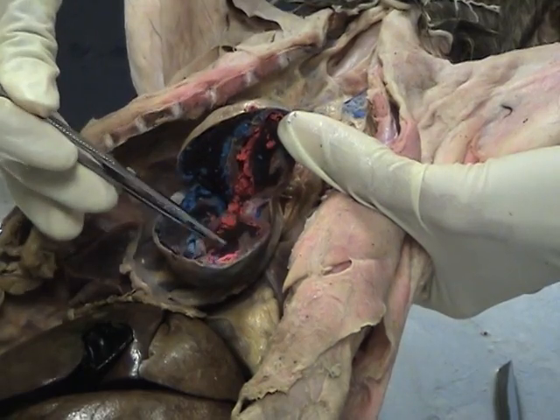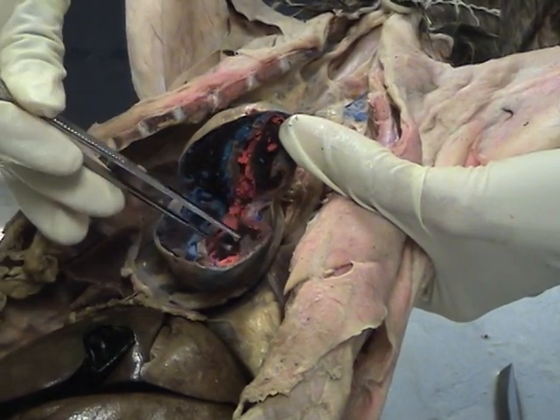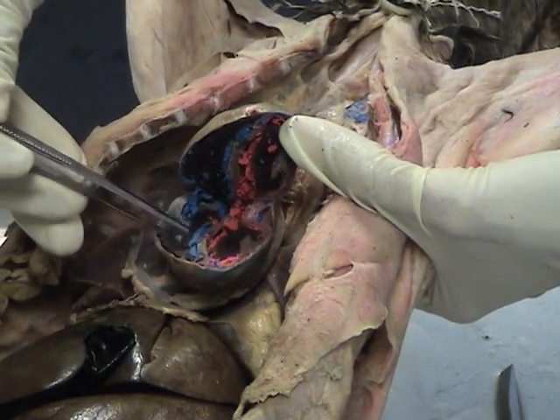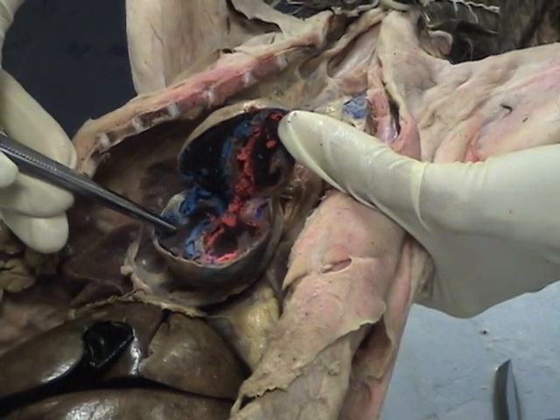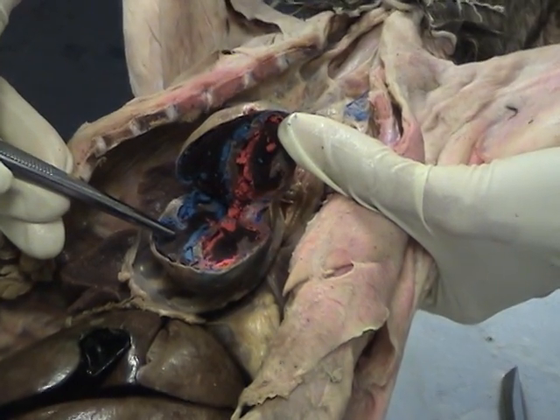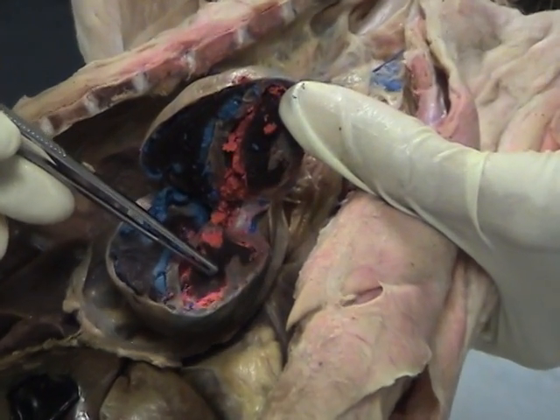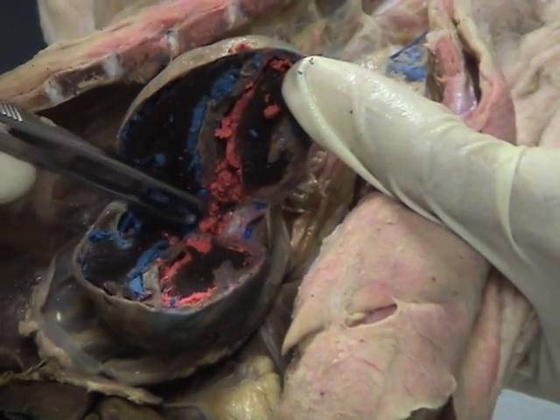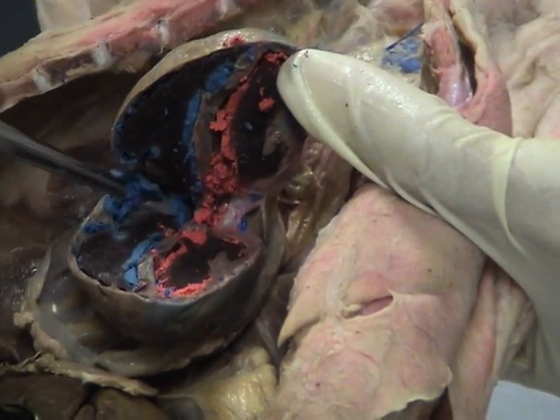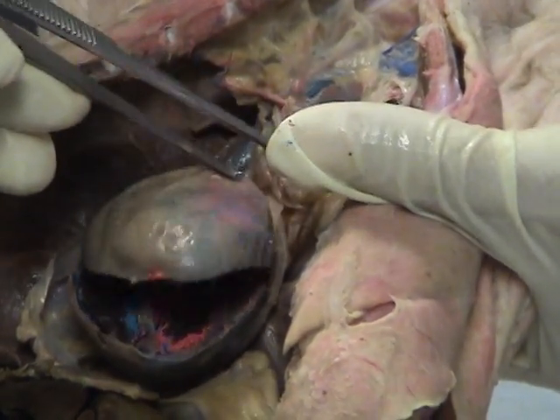That's why it's red — everything on the left side of the heart would be red, and everything on the right side of the heart would be blue. This would be the right ventricle, and this is the left ventricle. You don't really see too much of the atria.